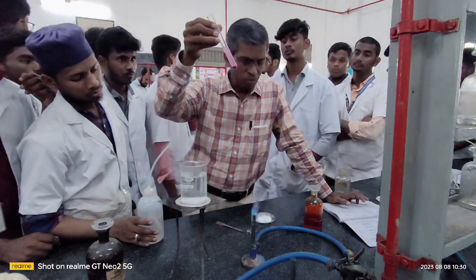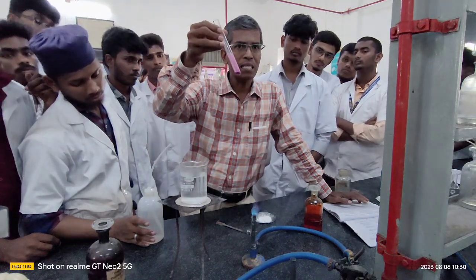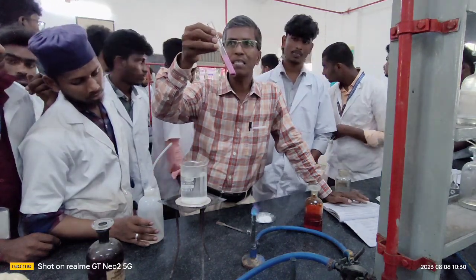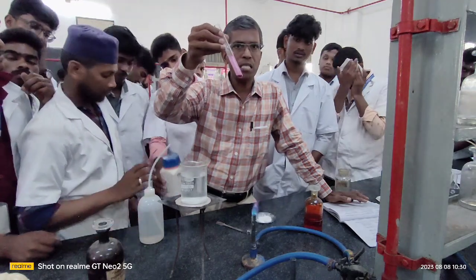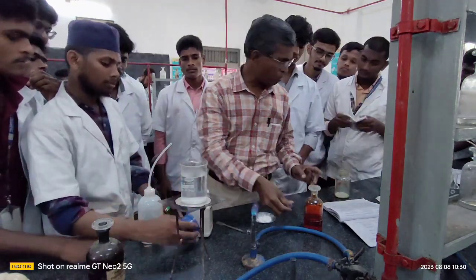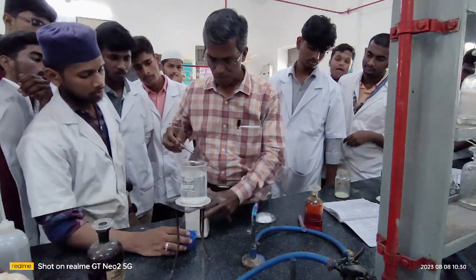So with the help of this, you are confirming that the conclusion you arrive at here is that the given organic compound is saturated. Now I am going to show you the result for an unsaturated compound.